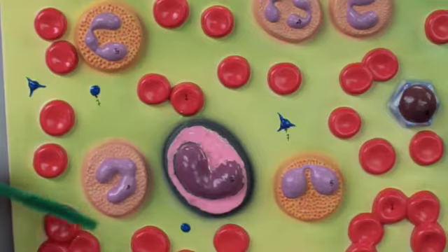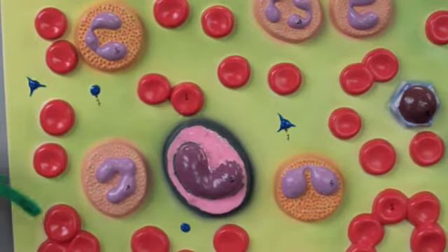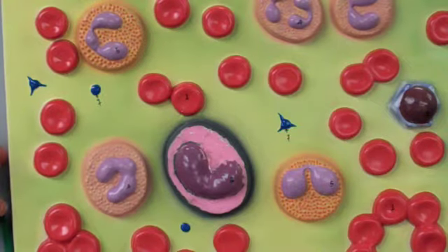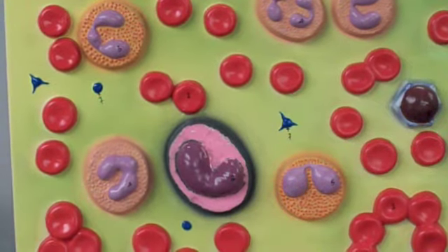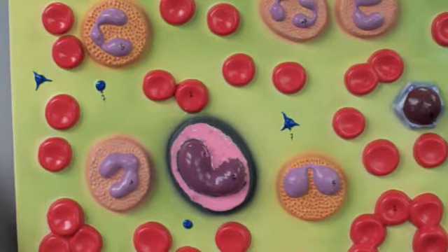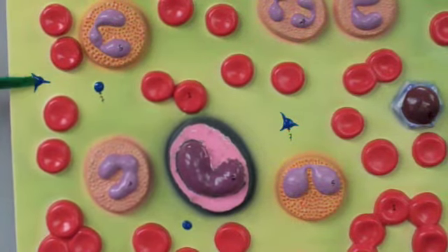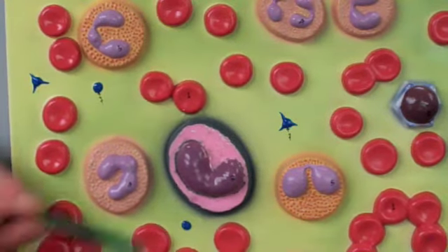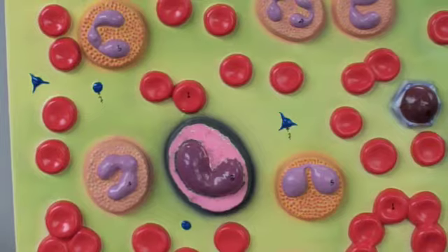The whole thing. So this is a blood smear made gigantic. We have red blood cells, we have white blood cells, and we have platelets on this plate. The red blood cells are these red ones, obviously. They're red. The platelets are these small little chunks. They're blue on this because platelets are just fragments, the thrombocytes.